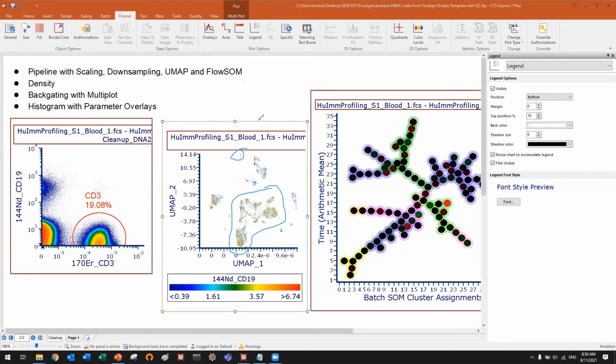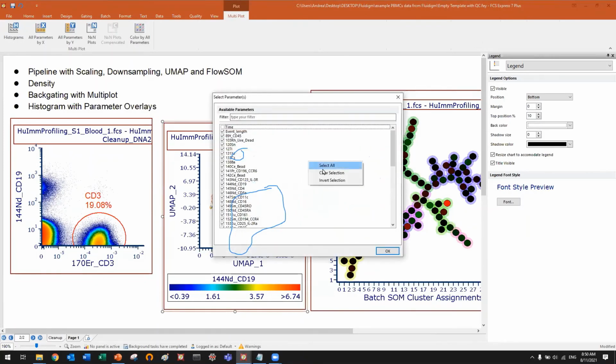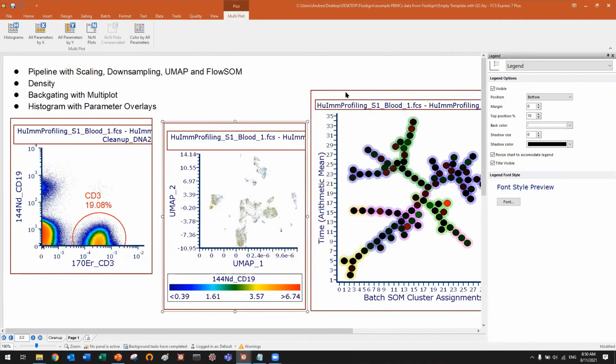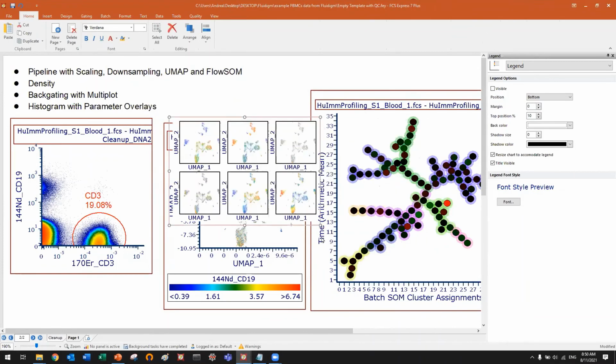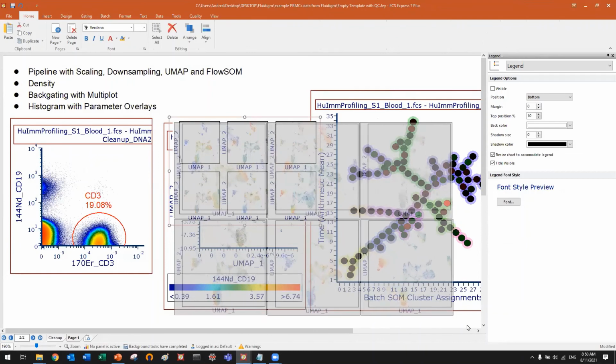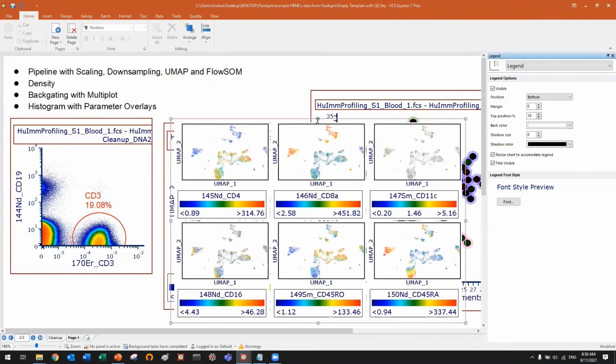Now you can create this automatically for multiple colors with the multi-plot capability. So I can say, okay, I want to see the UMAP density for multiple markers like CD4, CD8, CD11c, CD16, CD45RA, in an array and a row. Or you can select all, of course. And now you have 6 plots, displaying all the density distribution.